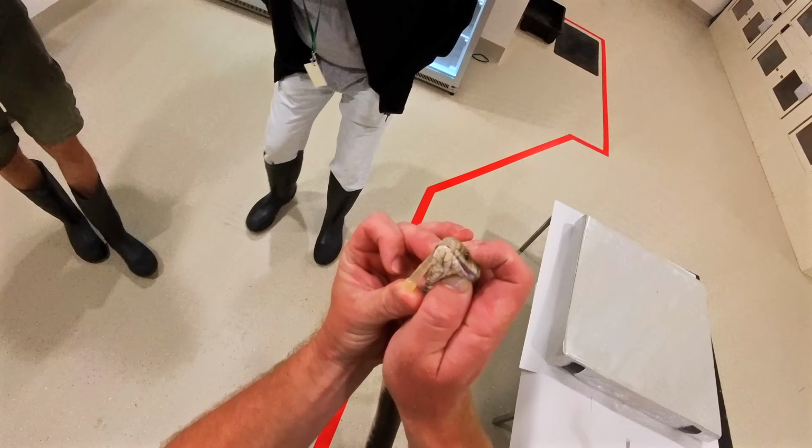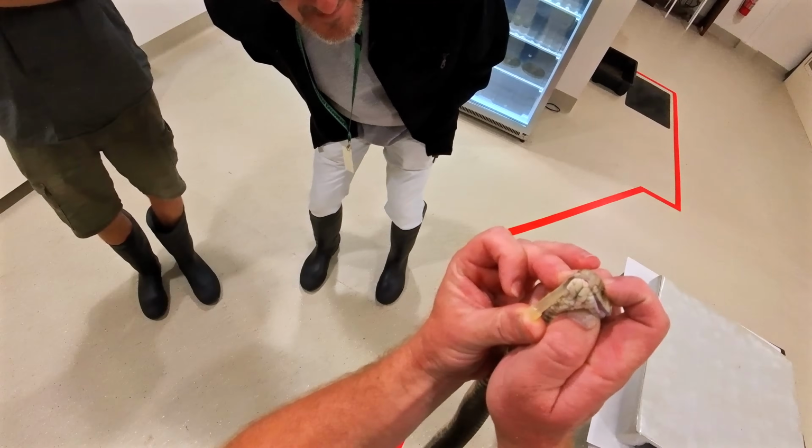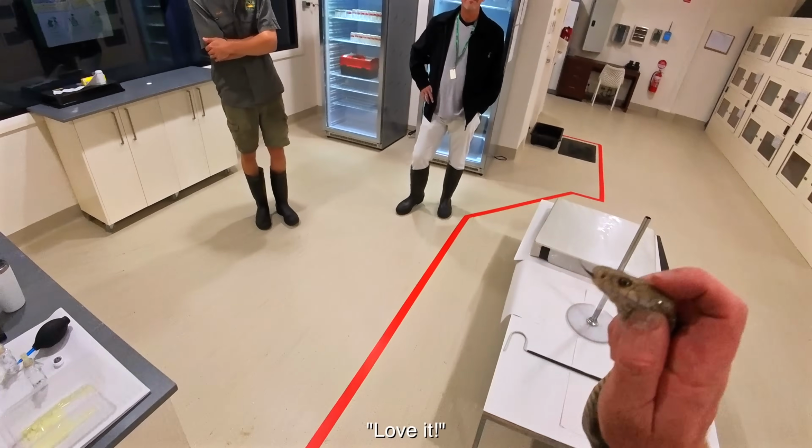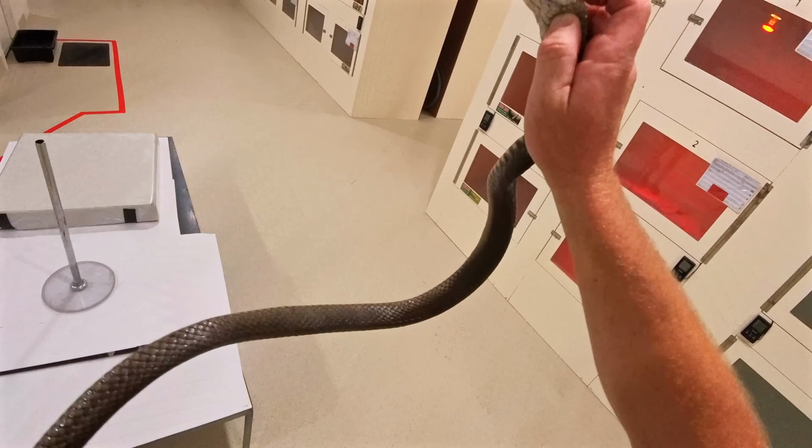So you can see there, that's almost half a pipette. Oh, yeah. That was just from one fang. Wow. What do you reckon of the venom rooms? Love it. Yeah? Good stuff. All right.